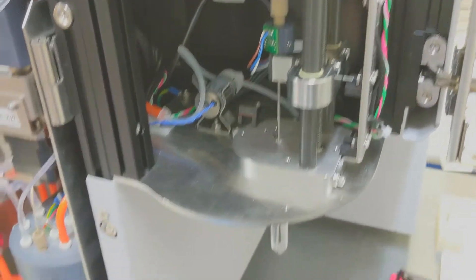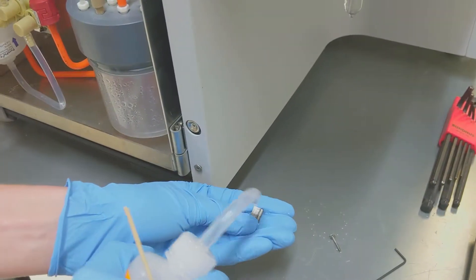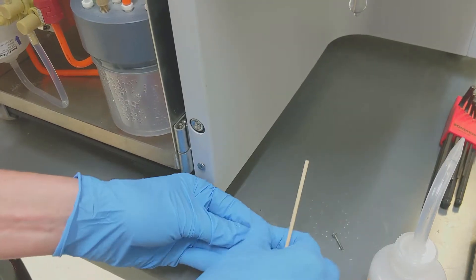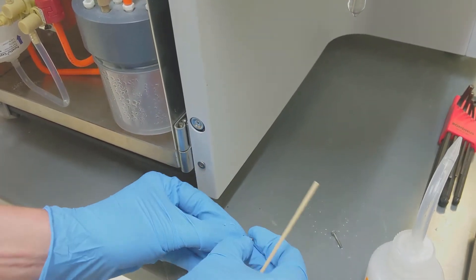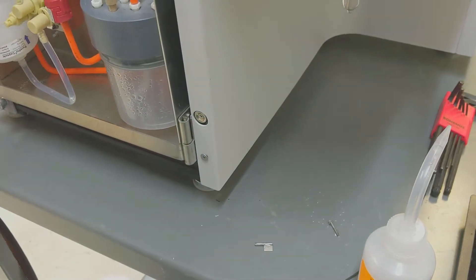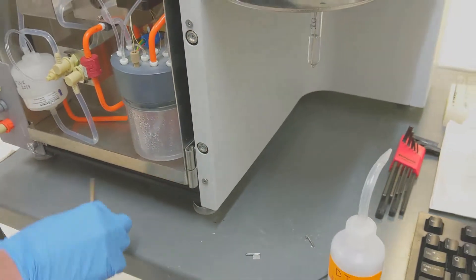Next I'm going to wash the flag too and really soak it well with DI water. Make sure I dissolve any little grain of salt that could be on there and wipe it off. Then once I'm done cleaning everything, I'm going to let it dry.